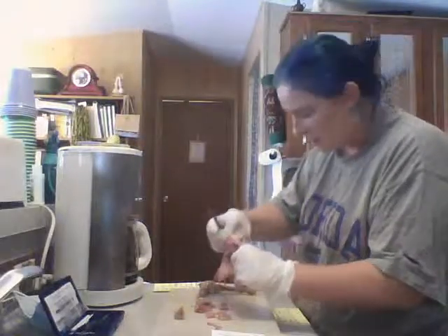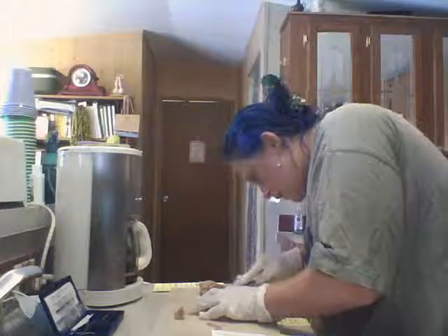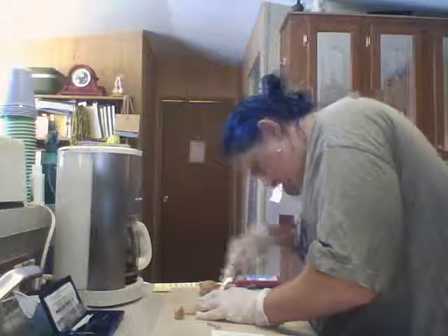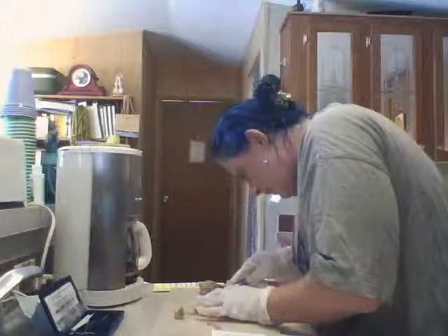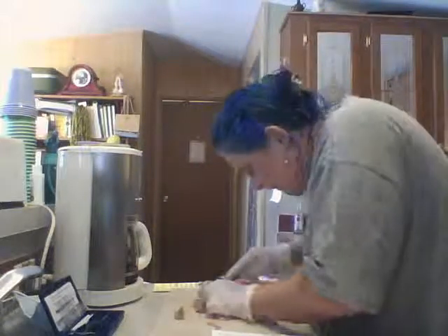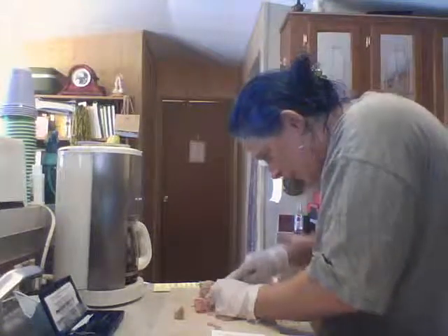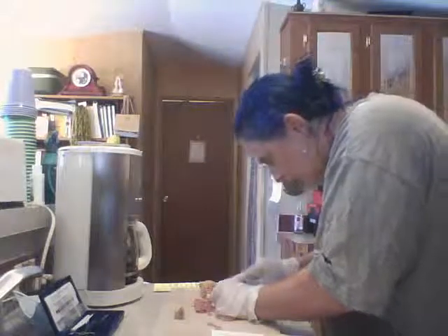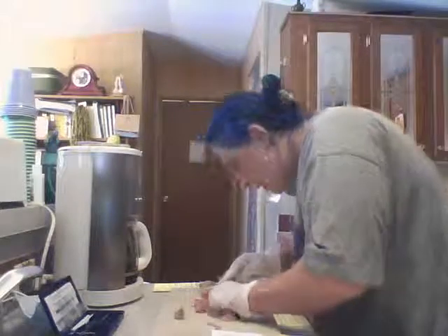That's the articular cartilage. Yep. All right.